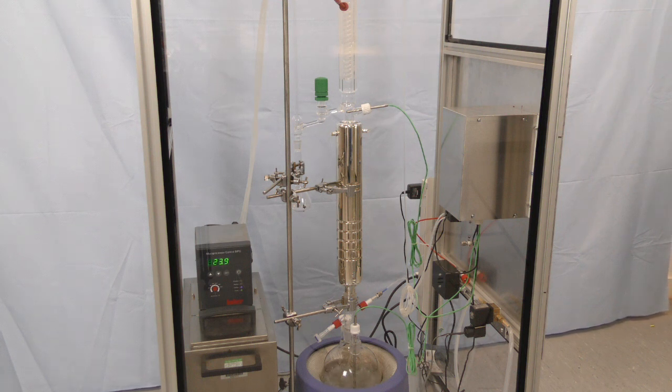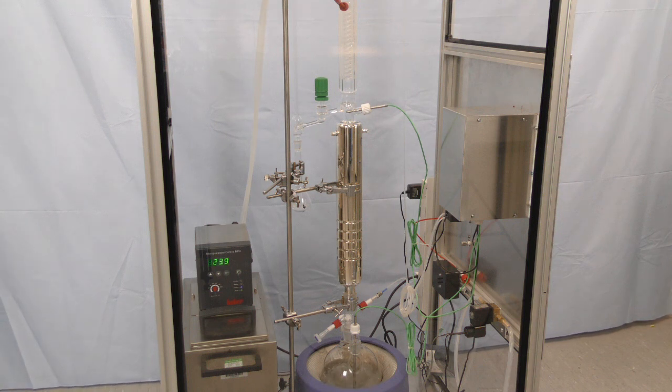The reboiler is being filled with a mixture of water and just a small amount of methanol, and the column is operating under conditions of total reflux.